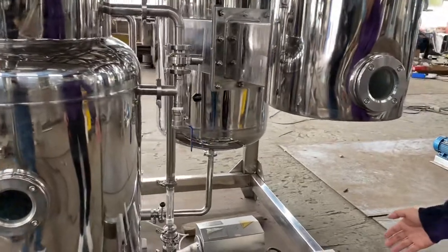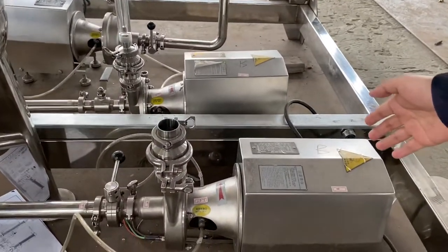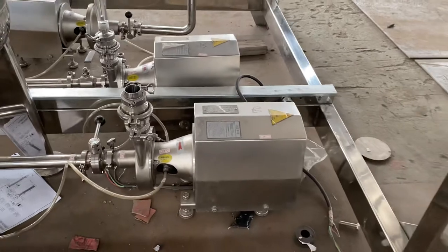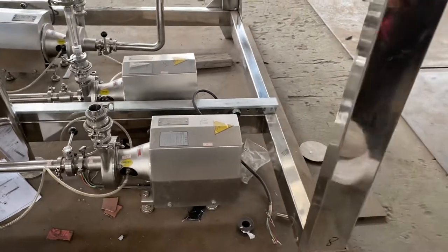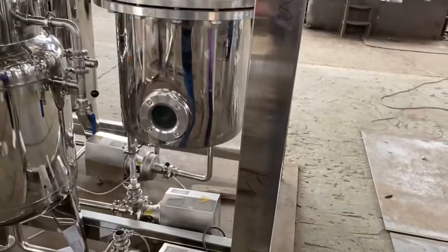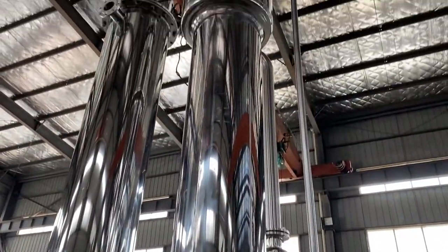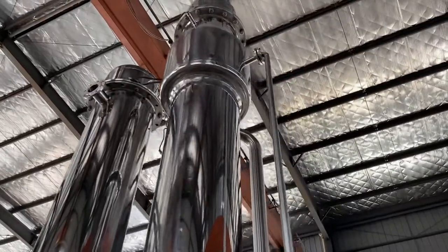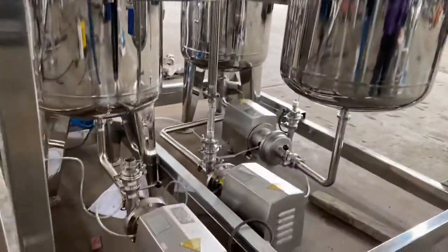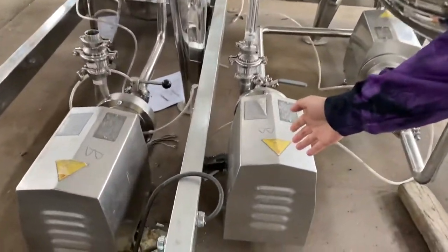This pump is the drain pump. And this is the evaporator. This pump is the feeding pump.